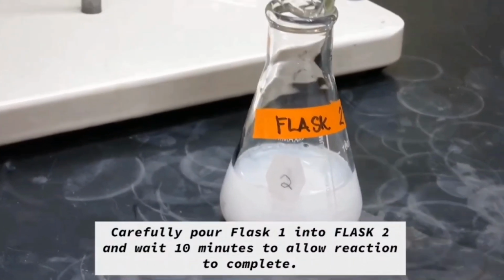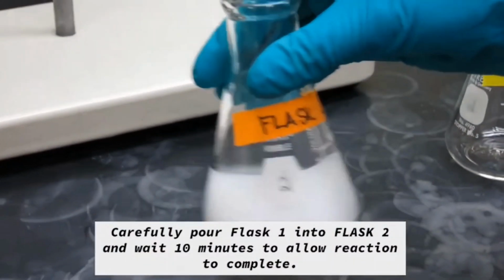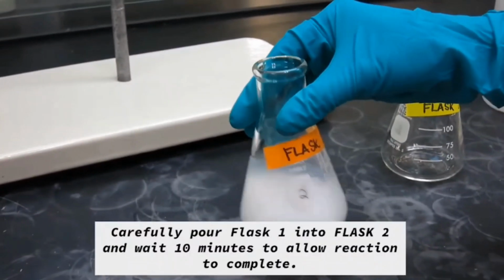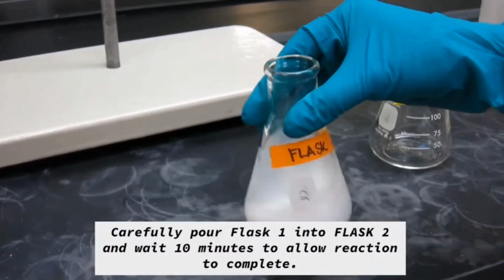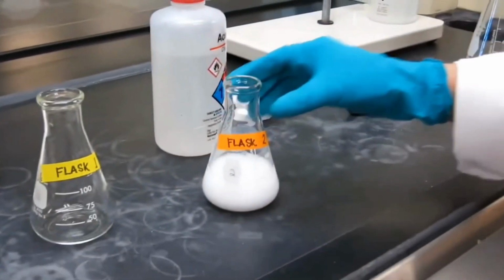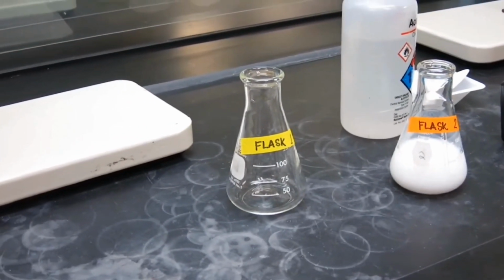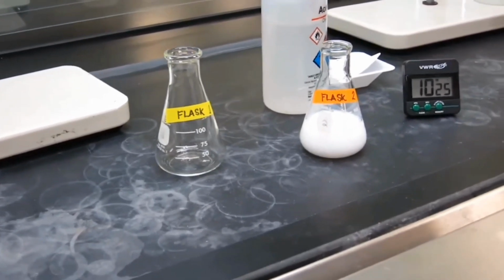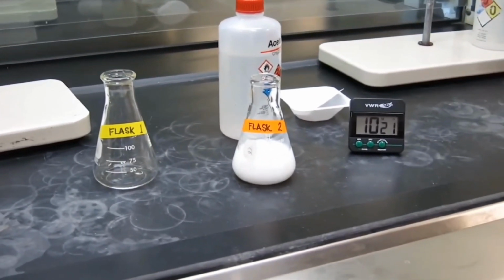And then the next step is you're going to mix the two. Carefully pour flask 1 into flask 2 and then wait 10 minutes to allow the reaction to complete. So you see here we added sodium carbonate and calcium chloride together and we got a milky solution.